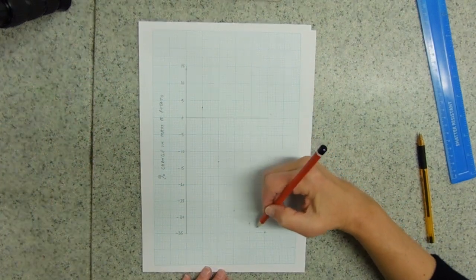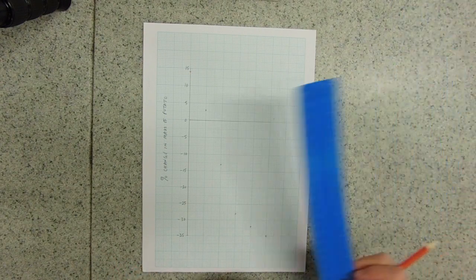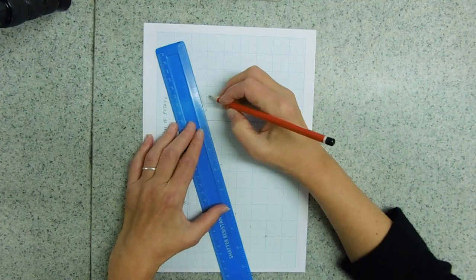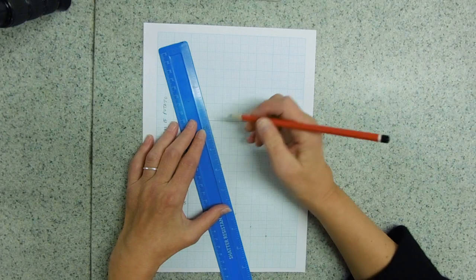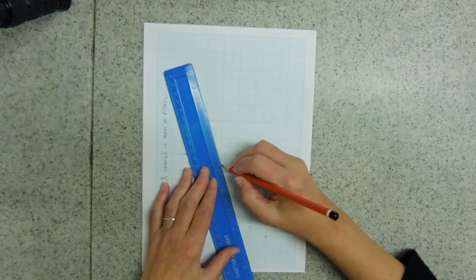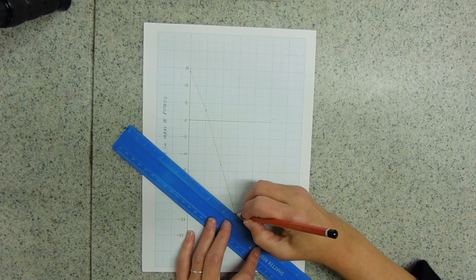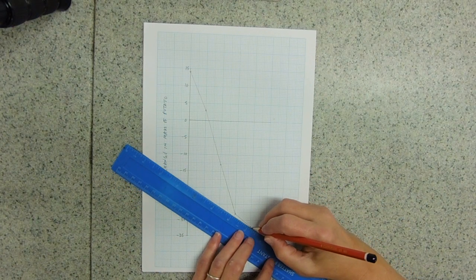That kind of looks like it's doing a curve, and it could well be — there might be a limit to how much mass a potato can lose. I could potentially draw a line of best fit, but my personal preference is to always join dot to dot, because I know I'm never going to be wrong with that. Unless there's a really clear curve, I'd always just err on the safe side. My technique for dot-to-dotting is to make sure my line goes through the centre of the point — put my pencil on one point, bring my ruler to it, check that again, and then join.